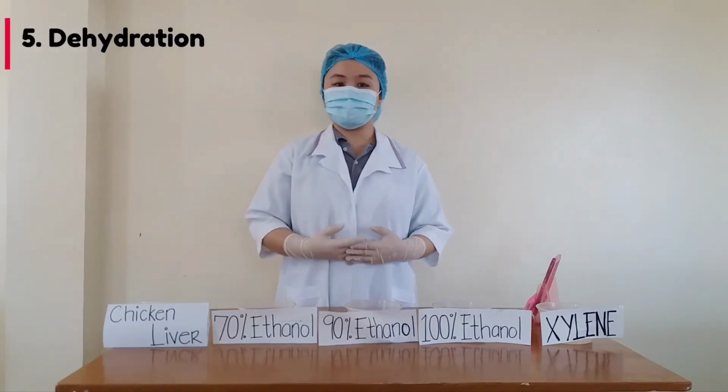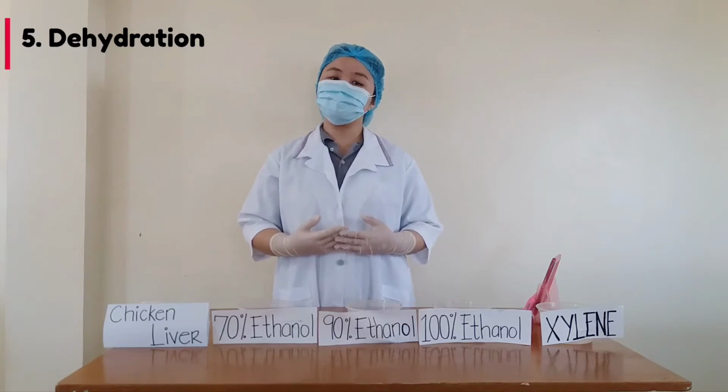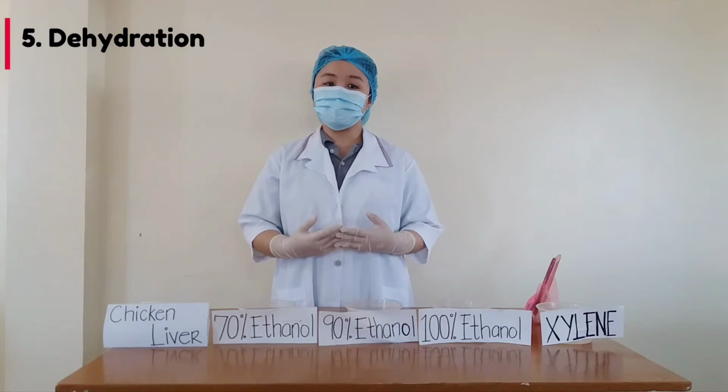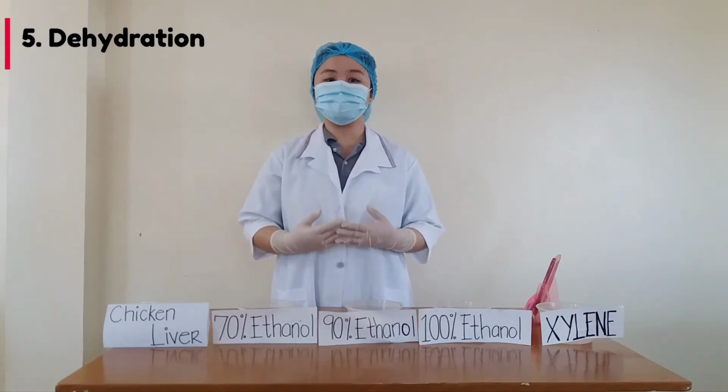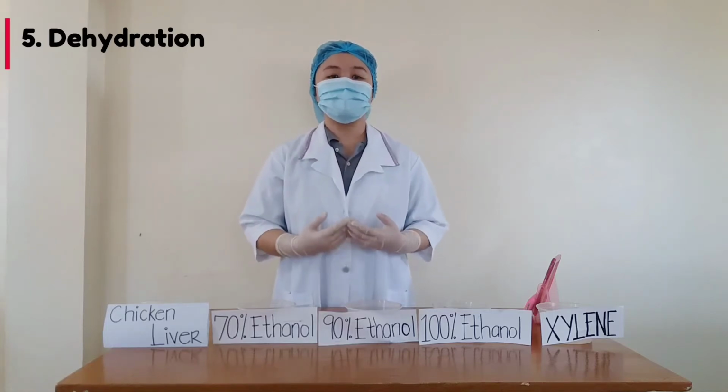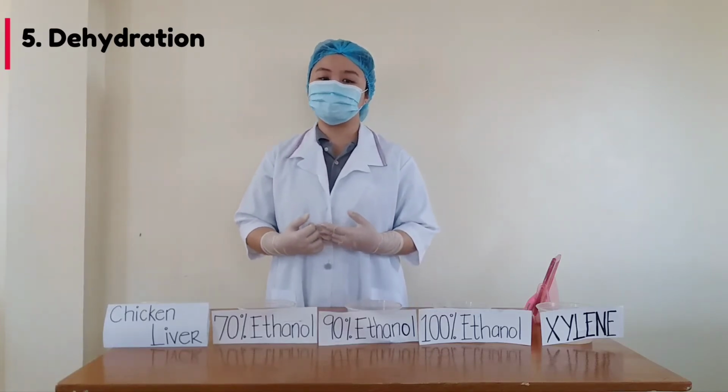Through the dehydration process, all the fixating solution and tissue fluid is removed. They are replaced with organic solvents, and these organic solvents are used because they are miscible with both the embedding media, which is the paraffin wax, as well as the alcohol used to dehydrate the sample.